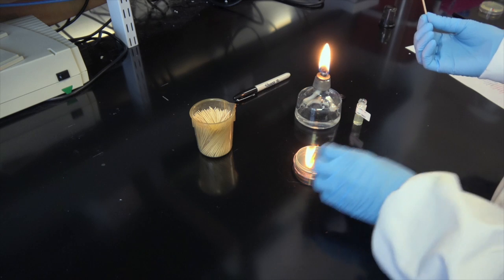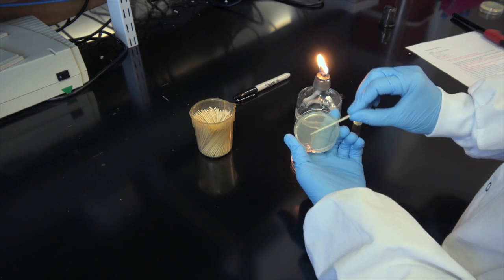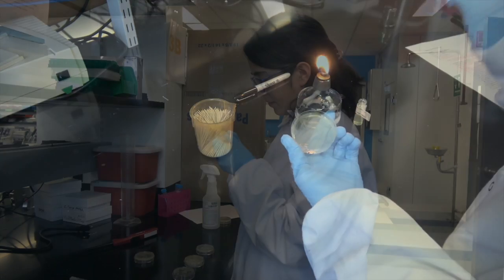In this video we will demonstrate how to streak bacteria on LB agar plates so that the bacteria form monoclonal colonies that can be used in later experiments.